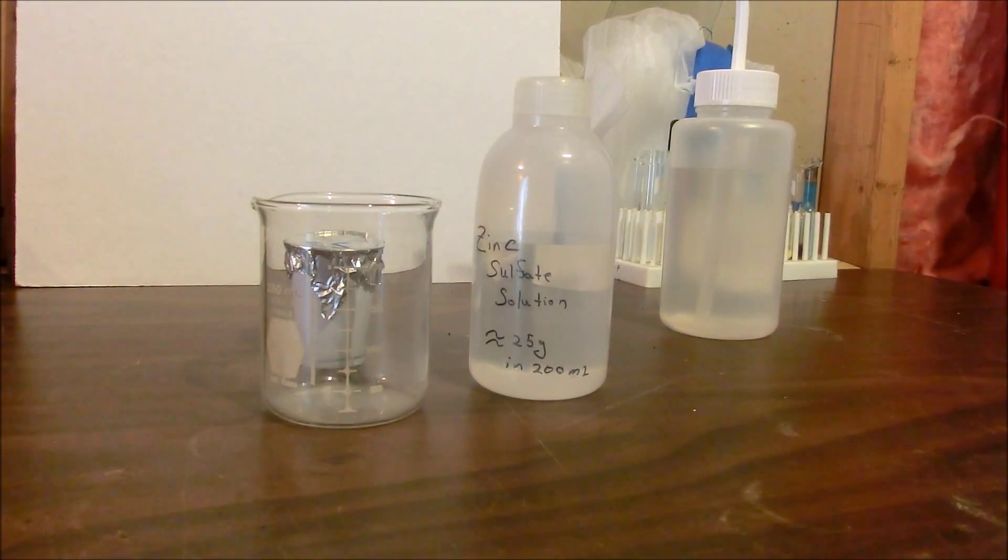After doing some rough calculations, that should have given me roughly about a 0.5 molar solution of zinc sulfate and then we'll take this setup outside and bubble hydrogen sulfide gas through it.